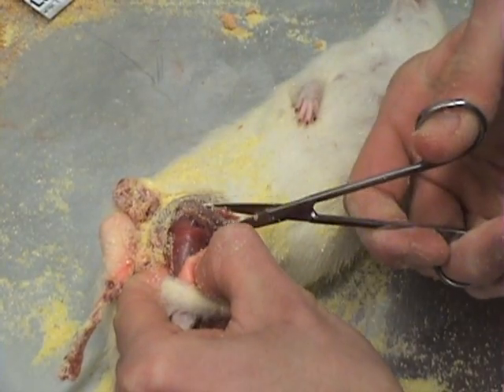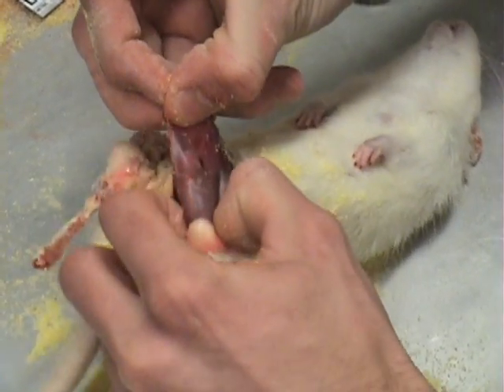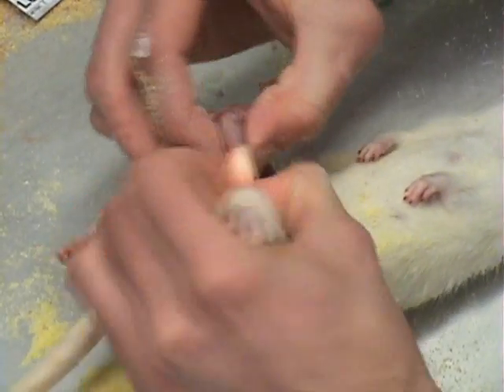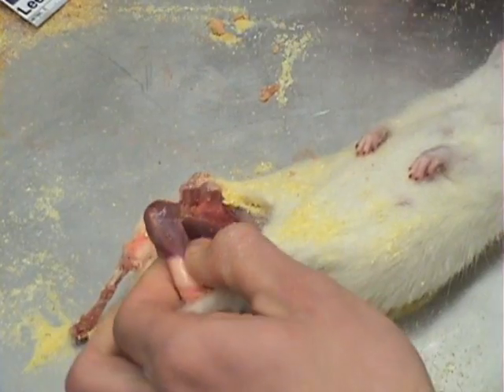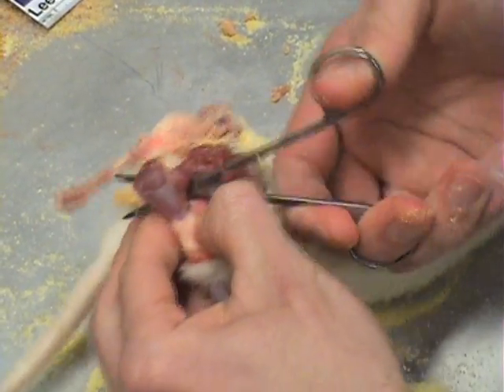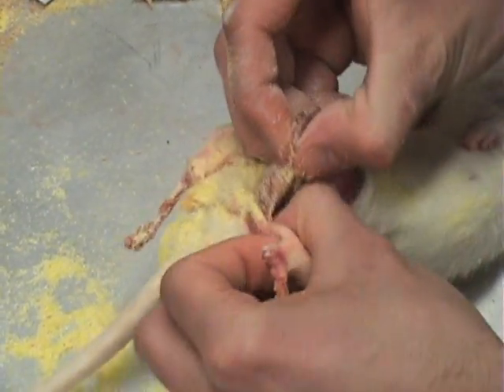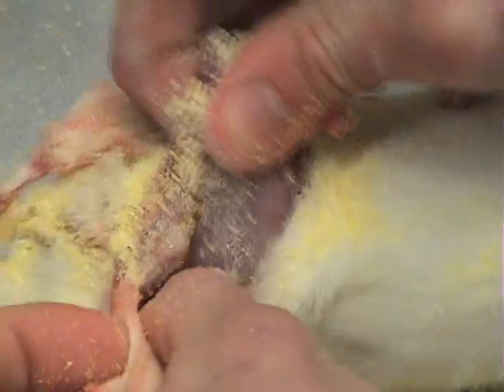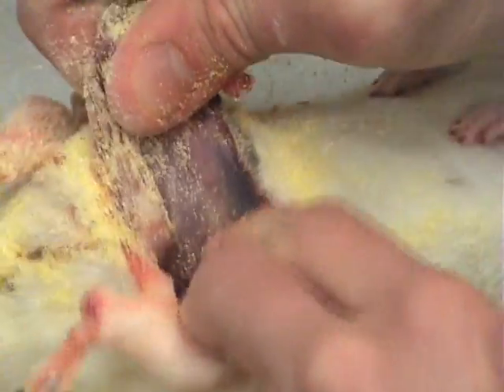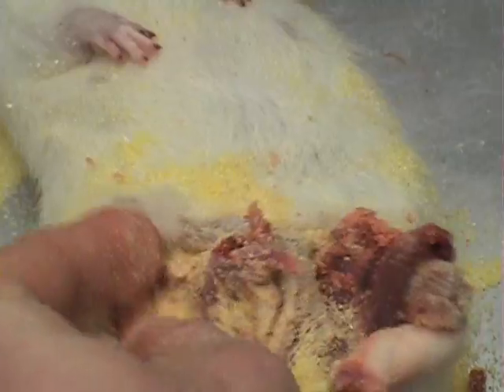The same procedure needs to be done for both hind legs. Once both hind legs are completed, begin working the skin away from the muscle. Add more cornmeal to absorb any fluids. This may be especially important if any of the cavity was ruptured during the incision.